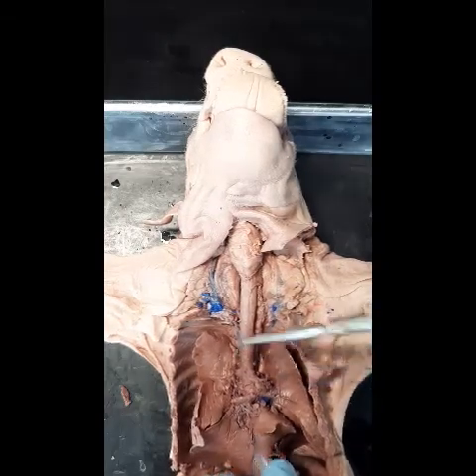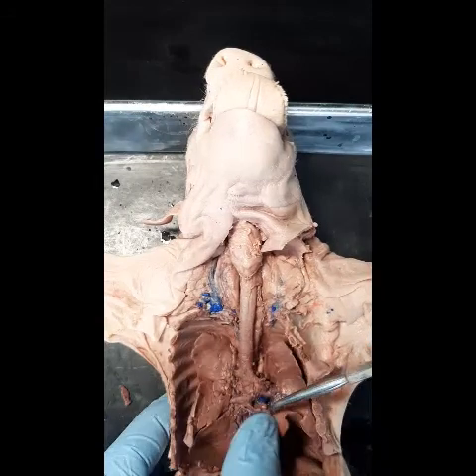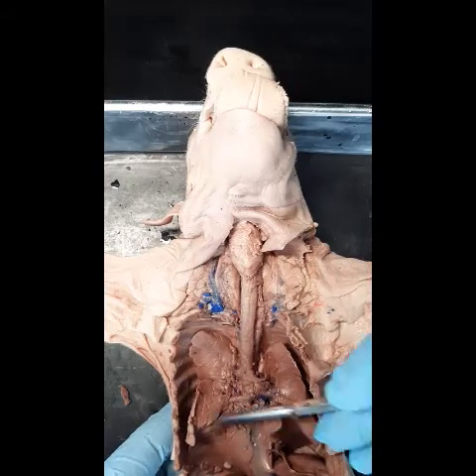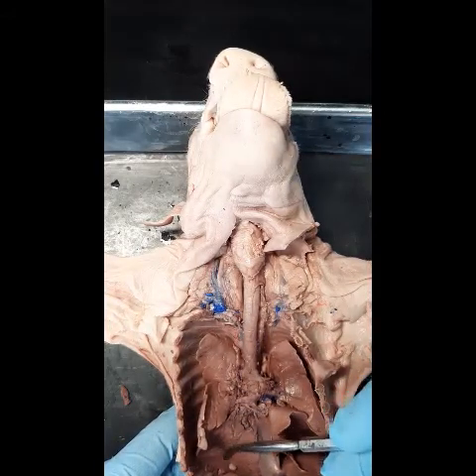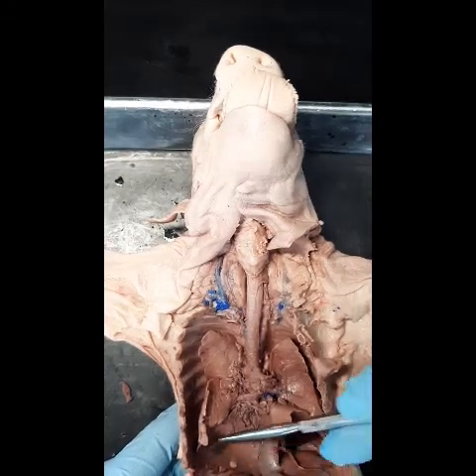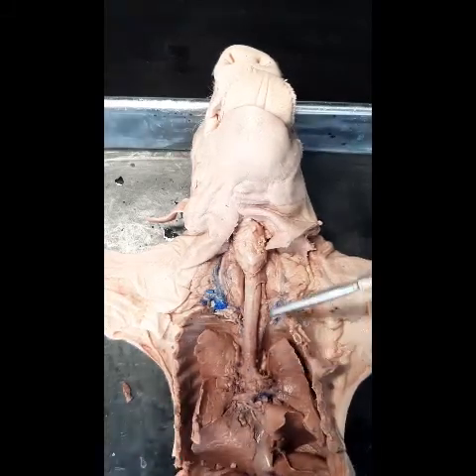These are the main organs and structures of the respiratory system. The primary bronchi lead to secondary bronchi, to tertiary bronchi, and eventually to small bronchioles, which eventually reach the alveoli where gas exchange takes place. Don't forget the alveoli — this is where gas exchange occurs.